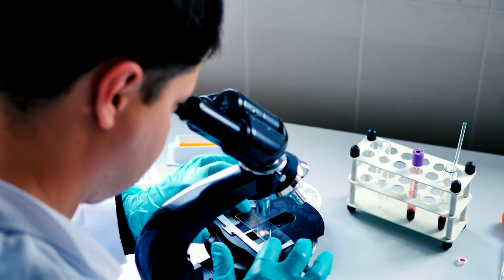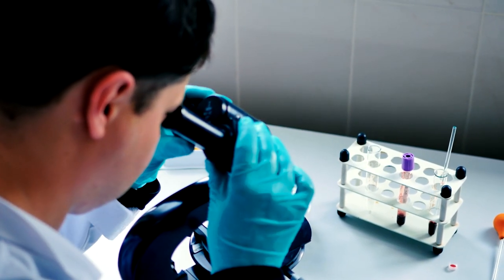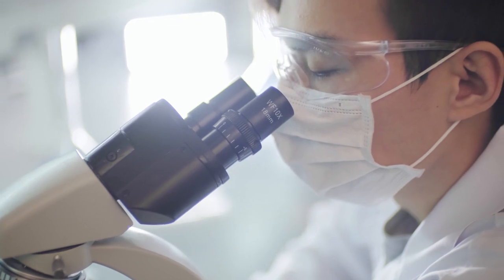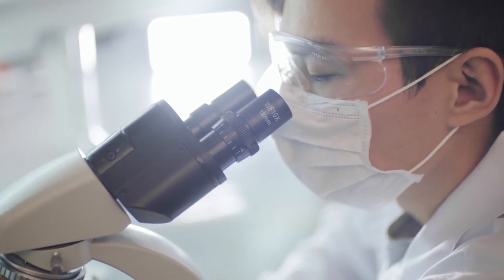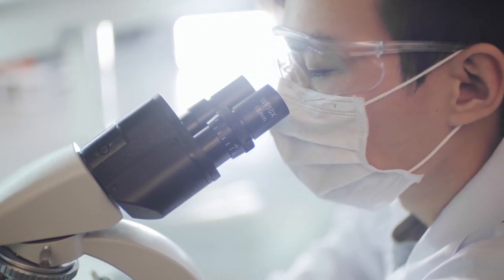In this video I will show you an example from the field of pharmaceutical research that employs light microscopes to potentially discover new treatment options in neurodegeneration to improve the life of patients.